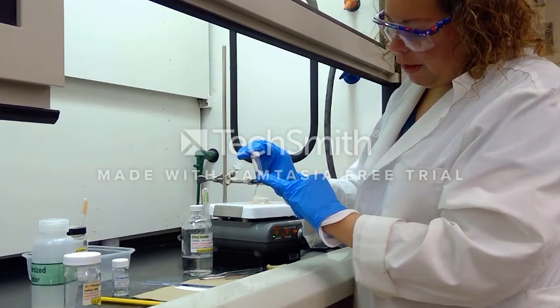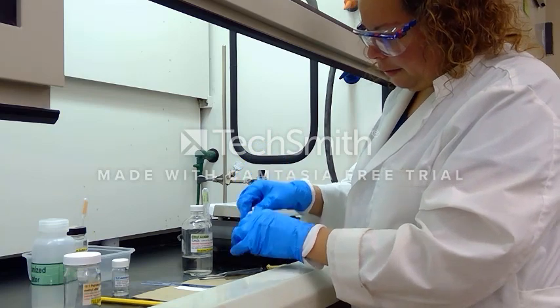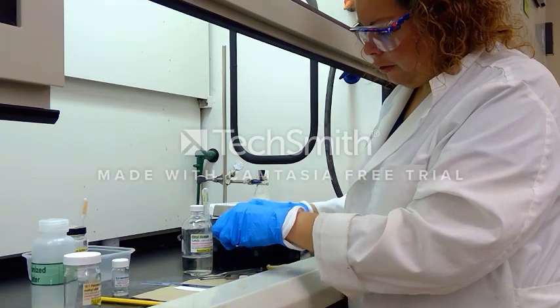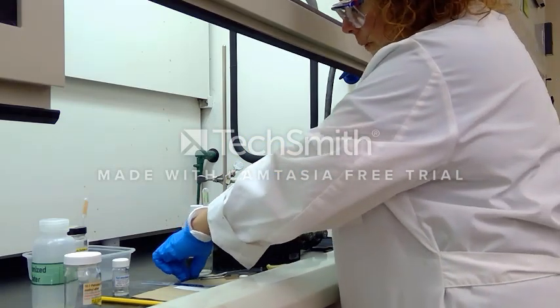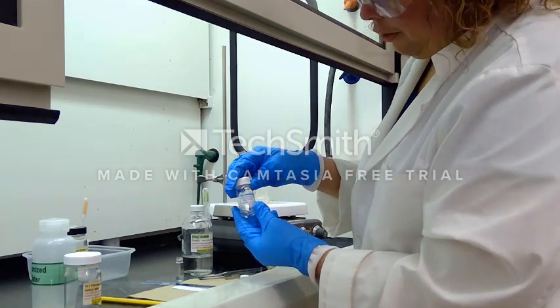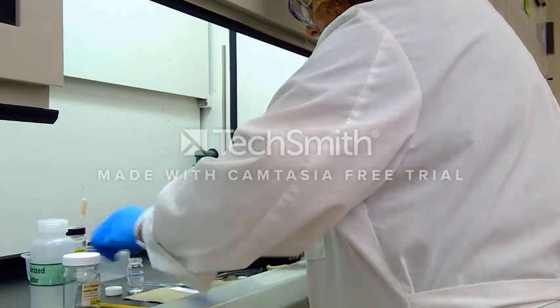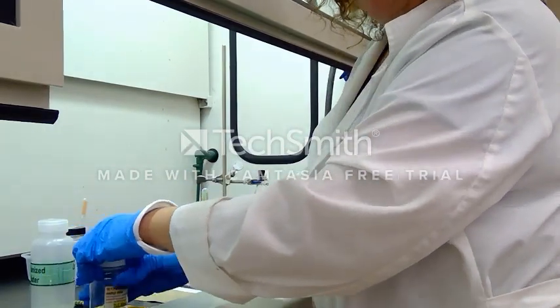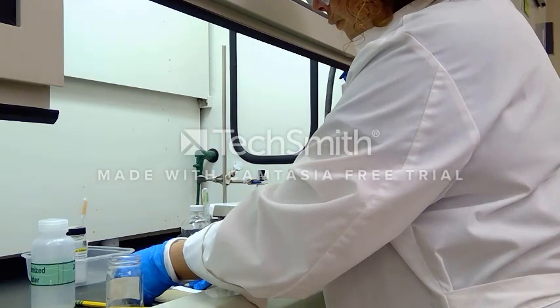In my TLC sample I have one layer of ethyl acetate and one layer of water. I'm letting the two layers separate — the aqueous layer is on the bottom since it is the heavier liquid. I'll take a small sample from the top layer to create my TLC spot. I'm also going to co-spot with a TLC standard containing a mixture of both benzhydrol and benzophenone. With my two solutions spotted, I'll place the TLC plate in the chamber and check in a moment.